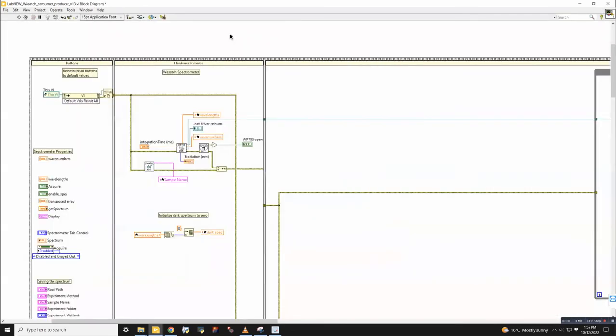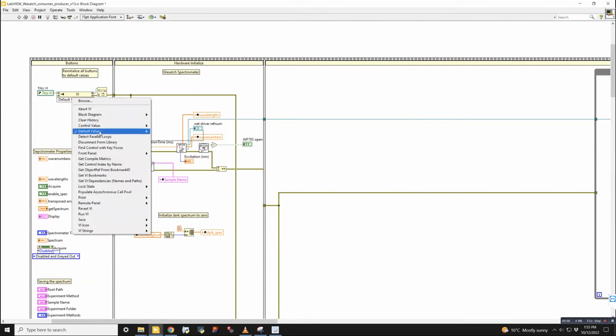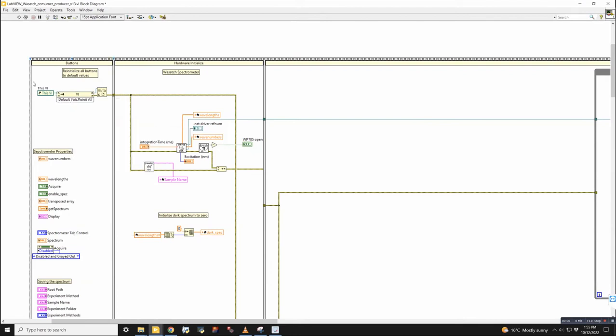Okay. Can I asked something? Yep. I always copy and paste this VI here. How do we write it from scratch? I have no idea. That's exactly how I did it the first time. I went online and downloaded some person's VI and then copied and pasted it into mine. So this is a property node and the property is this VI. And I'm sure you can find this down here under default values, but I don't know where to find this VI.